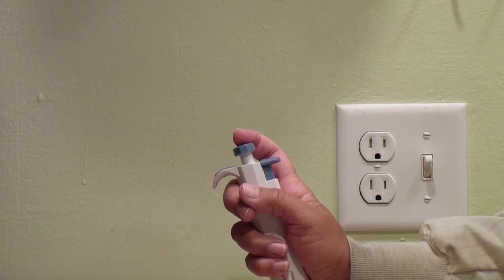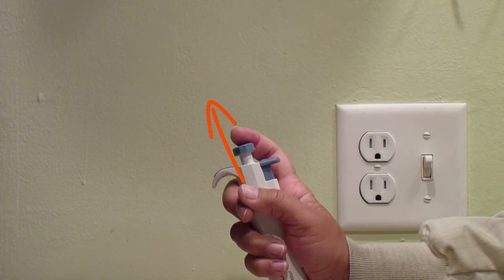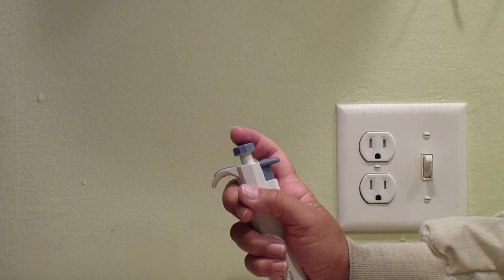You should gently guide the plunger up. If you simply release the plunger, the liquid can be sucked in too fast and shoot up into the tip, making it much harder to get all the liquid out in the next step.